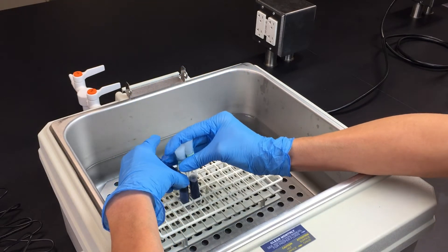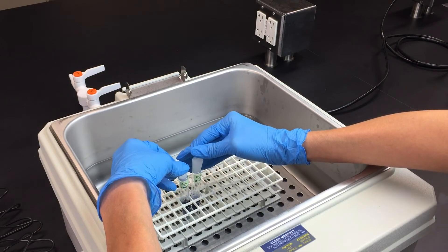At the end of 60 minutes, invert your tubes and note any changes.